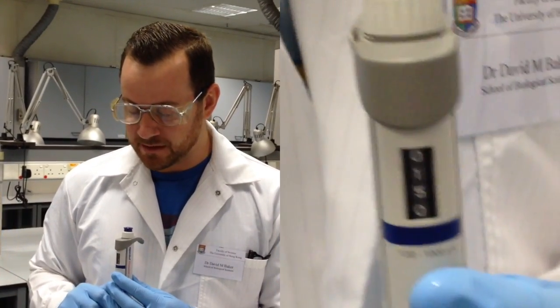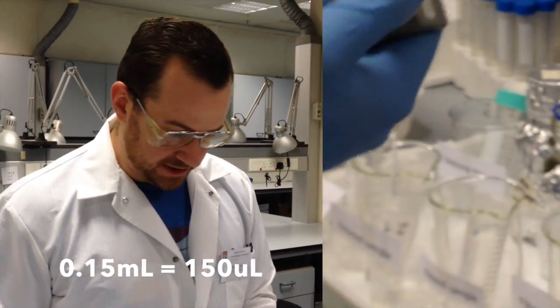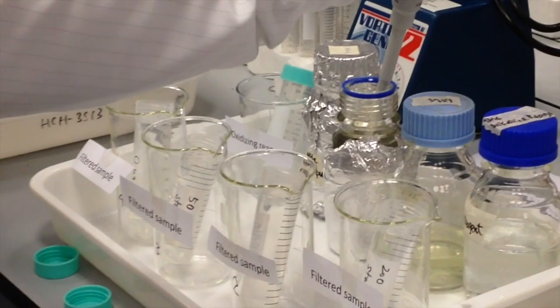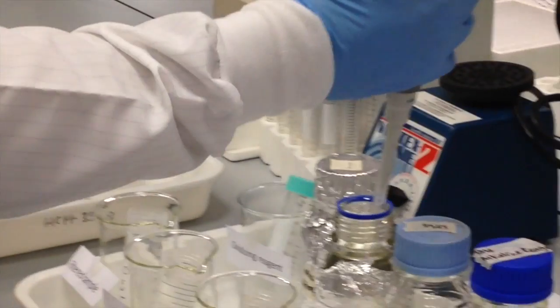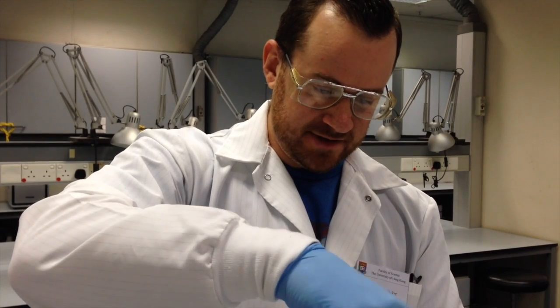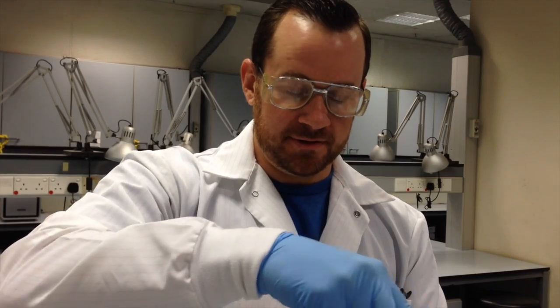There we go. So now I'm ready to add 0.15 milliliters of phenol to each sample. And again, as long as I don't stick the tip of my pipette into the sample itself, I can use the same pipette. And I'm going to want to cap the phenol right away so that I don't have to inhale the vapors anymore. And make sure that the aluminum foil is covering the phenol because it is sensitive to light.